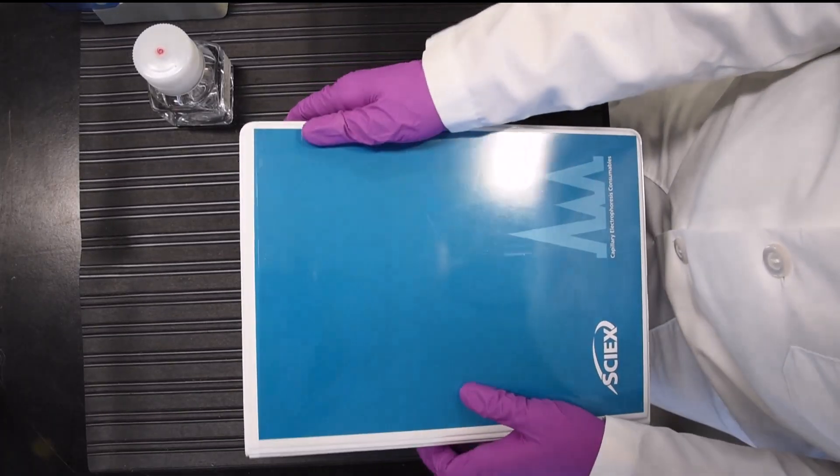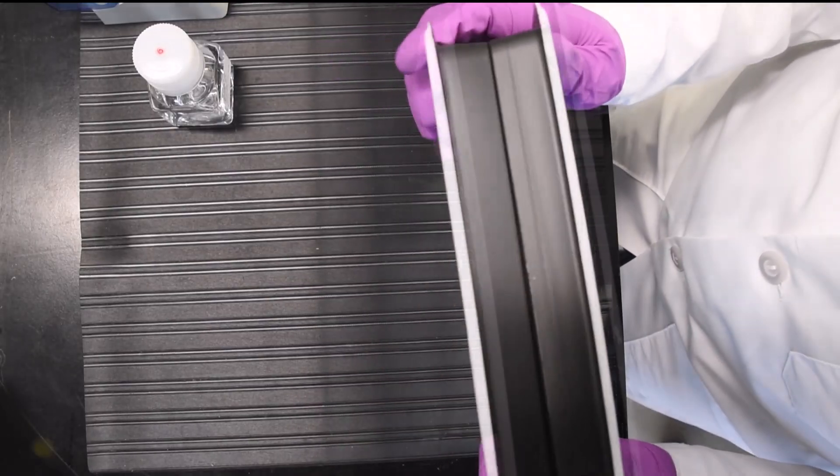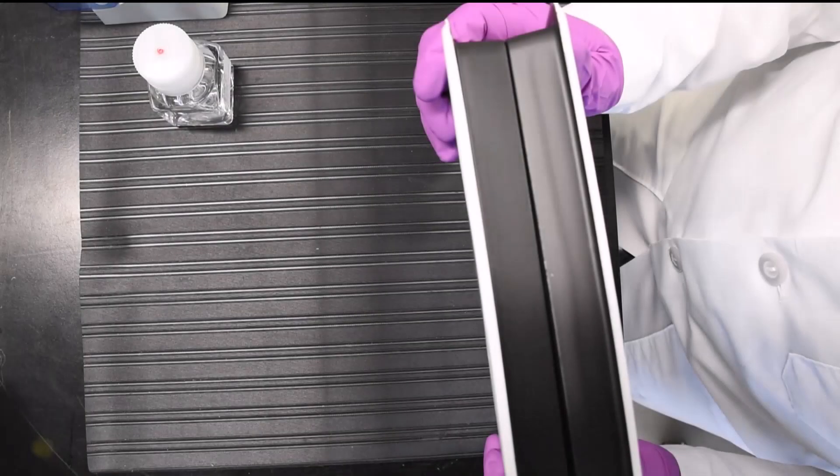Then, store it in an upright position. Remember to follow the specific storage conditions recommended for your capillary in your application guide.